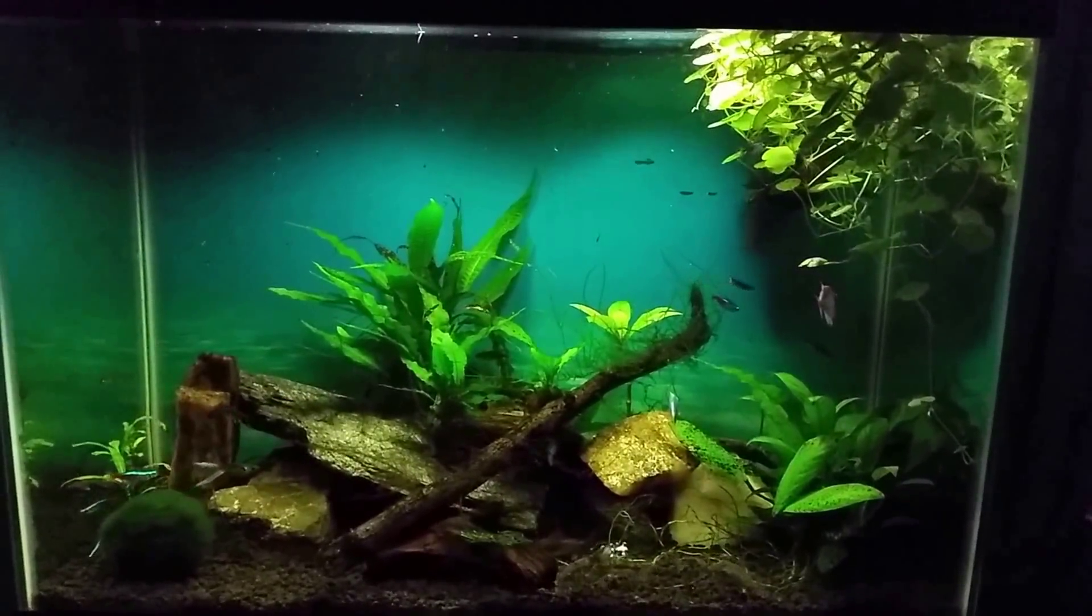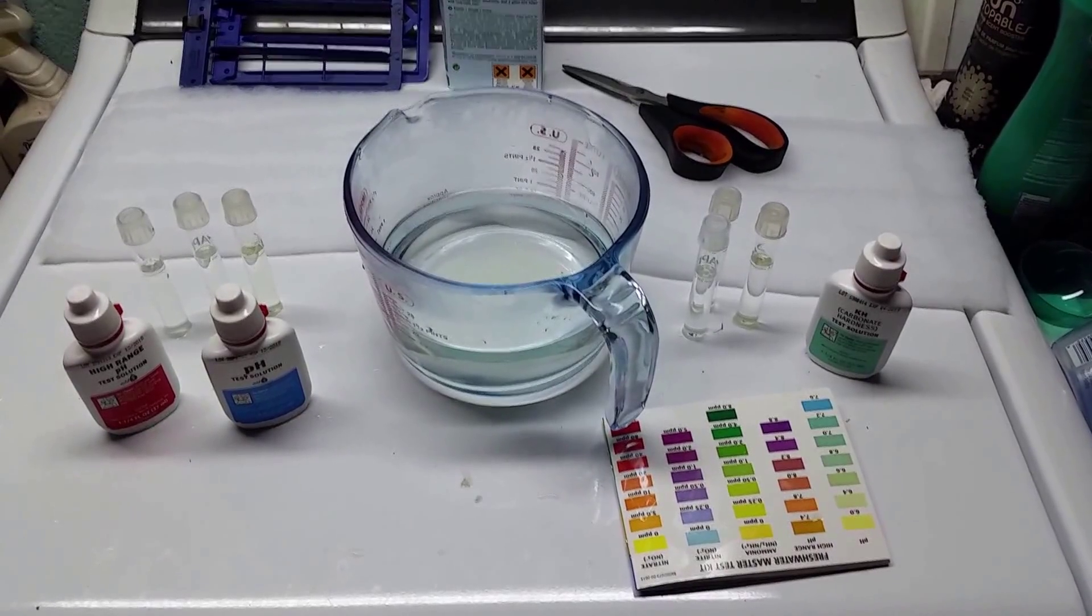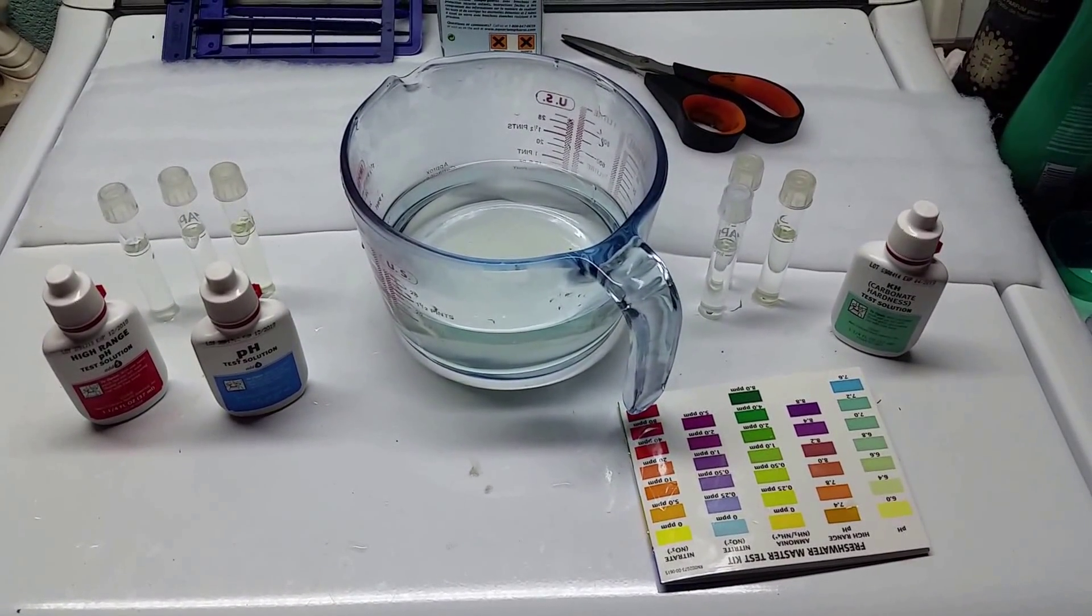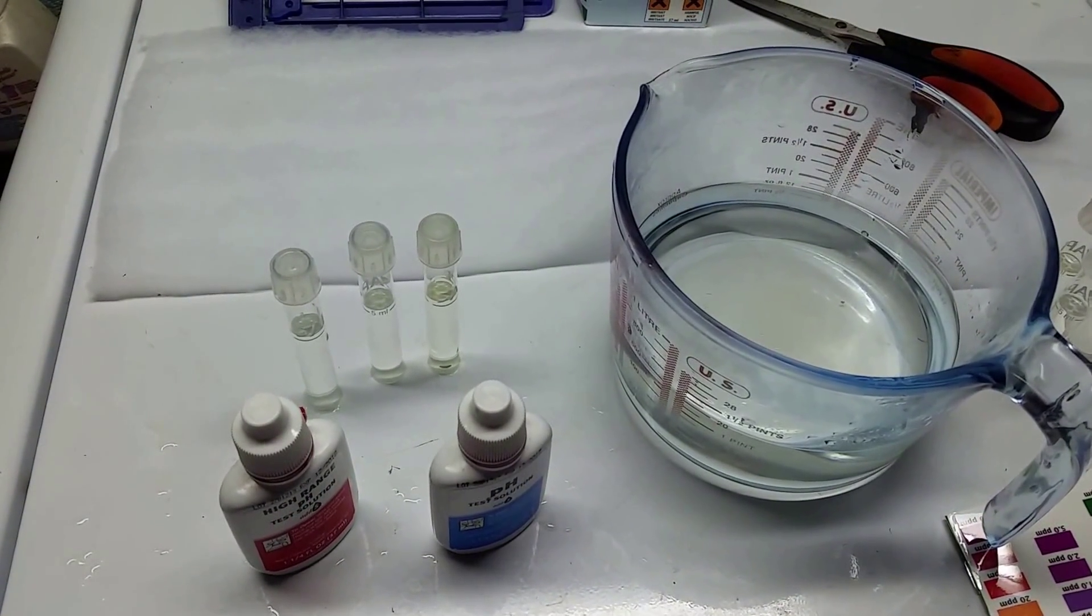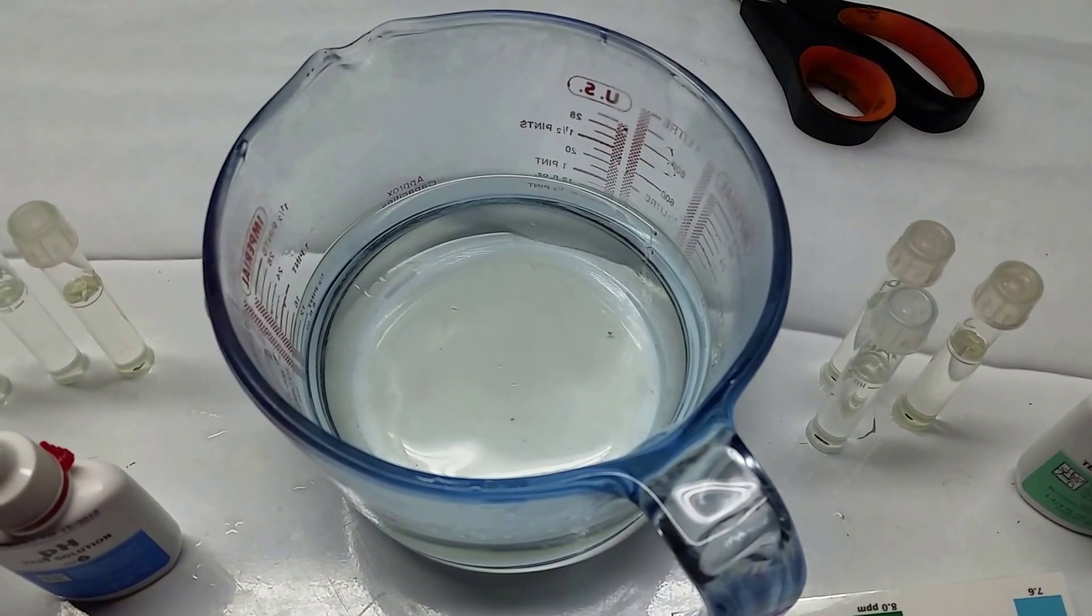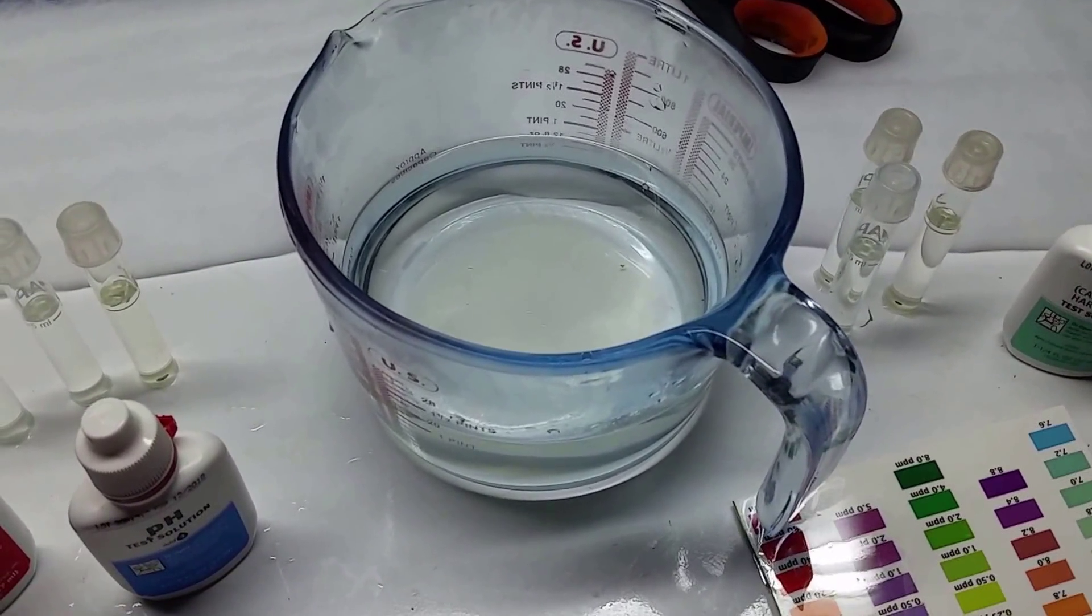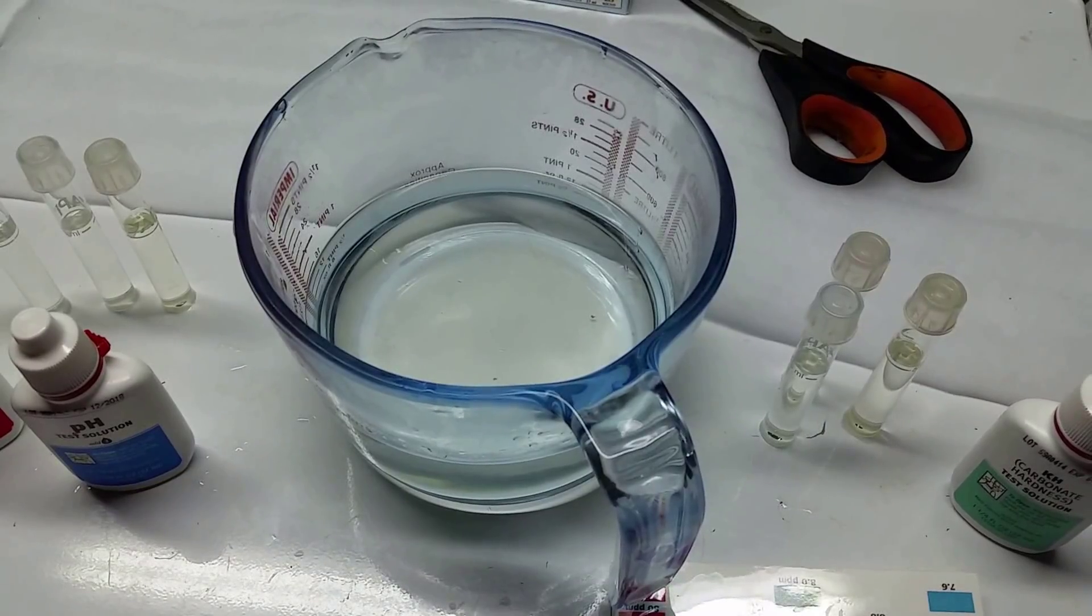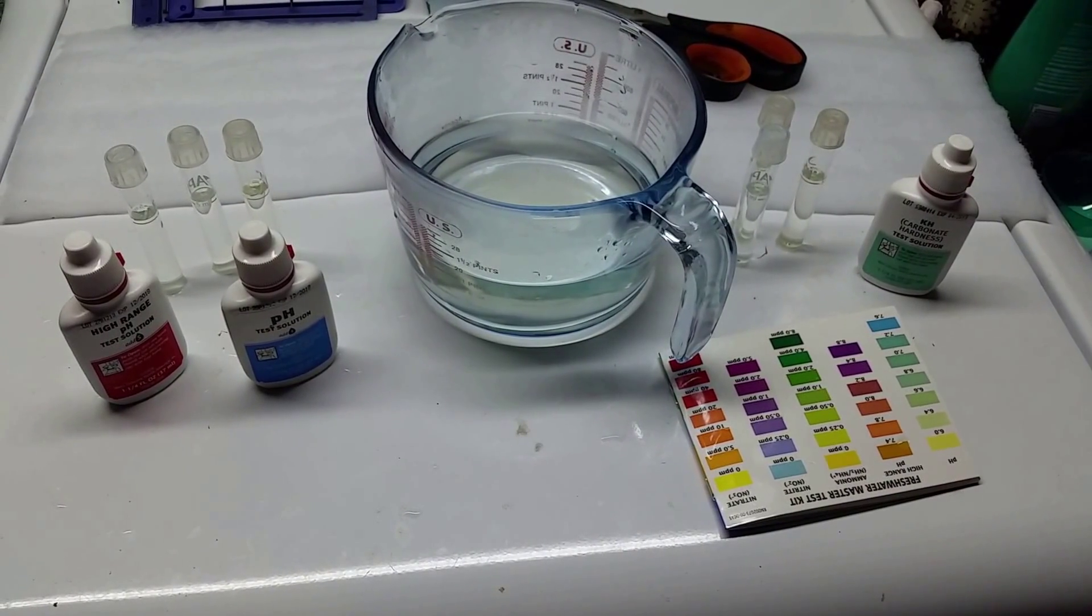Let's move on to the final part of this video and we're going to start doing some testing. Here we are at the moment of truth. It has been 24 hours since I set everything up. Before we do the actual testing, I want to explain what I got going on here. The vials I have here on the left are out of my gourami tank just a moment ago. That's the place where we got this original source water that has been sitting in my office on the fish tank overnight. It's an unstocked fish tank so I'm not using that as a comparison, but I did set it in a place where it would be in normal atmospheric conditions for my upstairs.